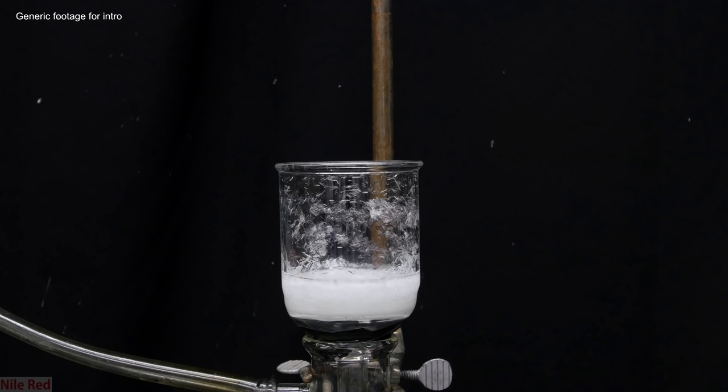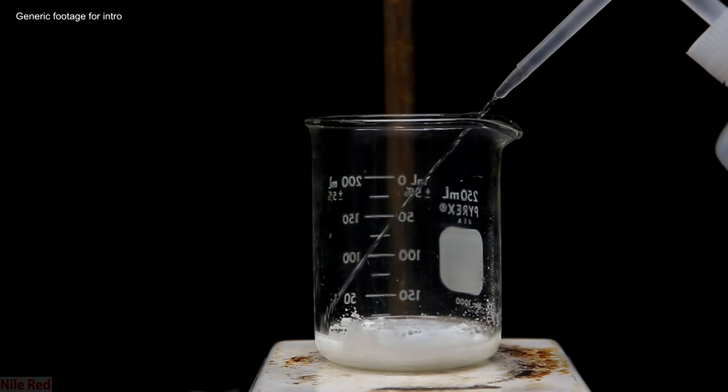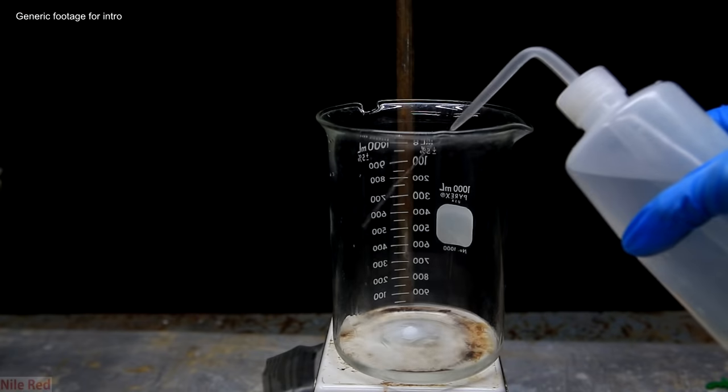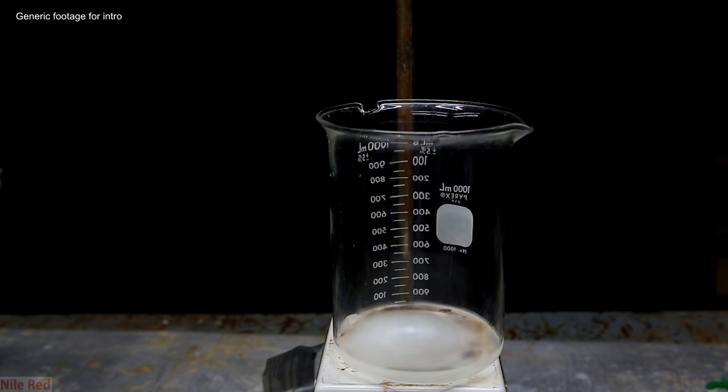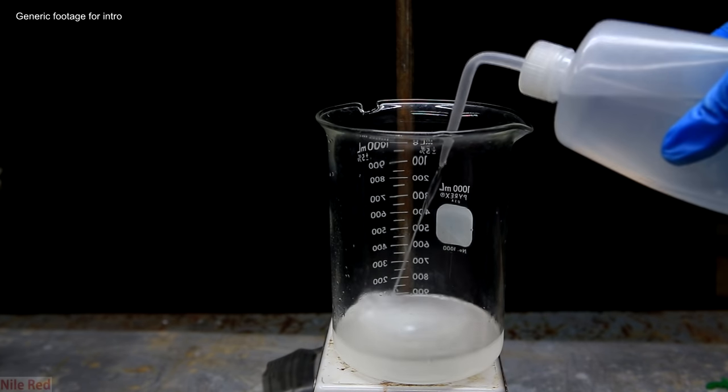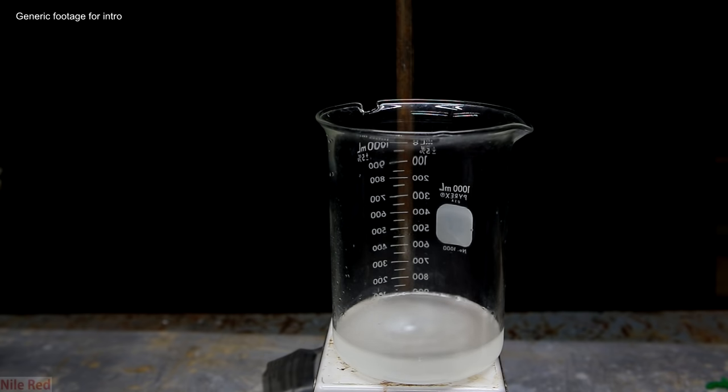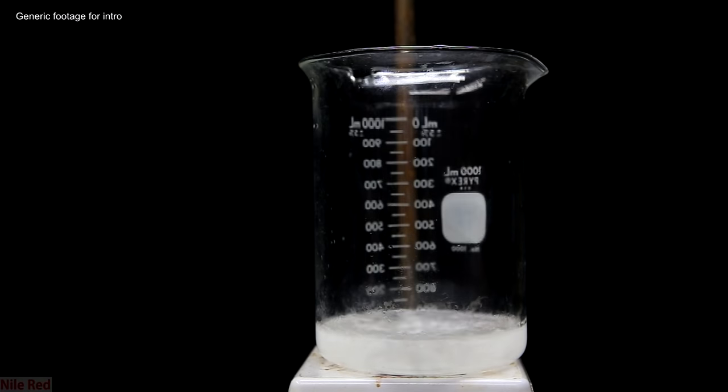This technique can be done with or without heating, and I actually demonstrate it in my lidocaine video. In that example, I fully dissolved my lidocaine in ethanol, and I slowly added water. Lidocaine is extremely insoluble in water, so as it's added to the ethanol, its solubility in that solution will slowly decrease.